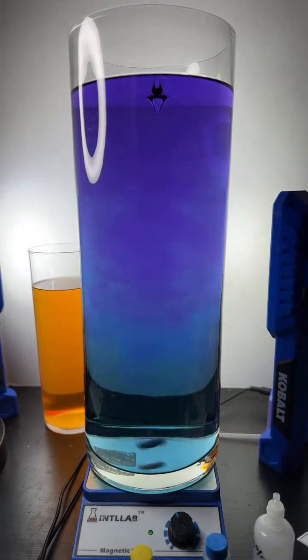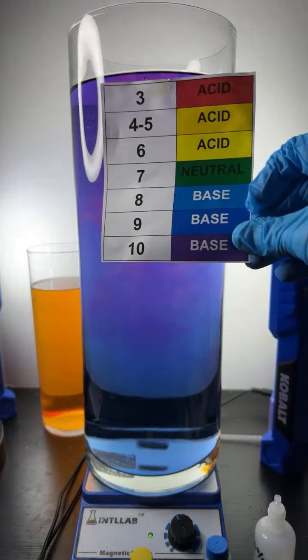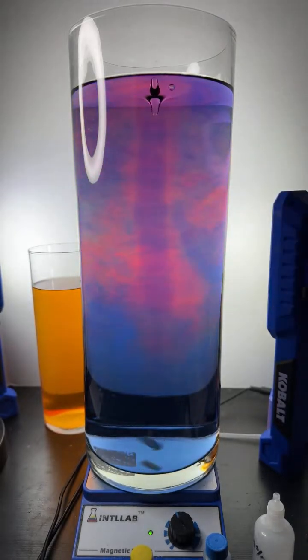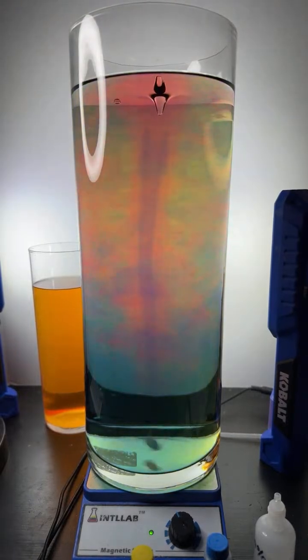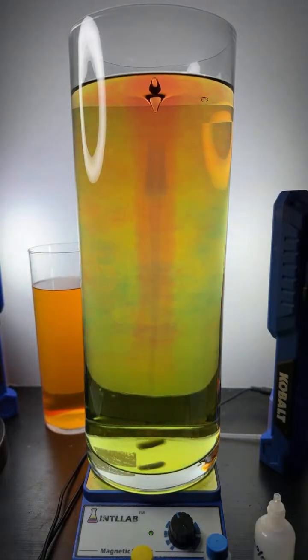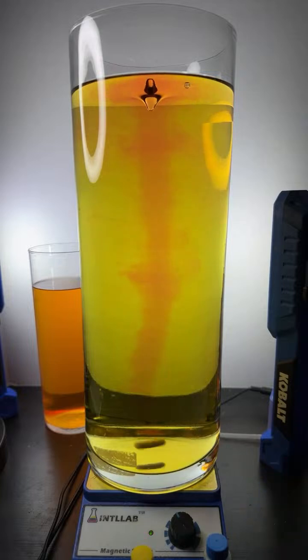Thanks, Air Moist. I think they are some interestingly beautiful colors as well. I'm going to start adding some acid. Remember, the acid will lower the pH. These are the pH values that you can expect to see, the different colors. And, of course, as I add acid, it drops. Pretty nice, huh? We got it down to a low pH.